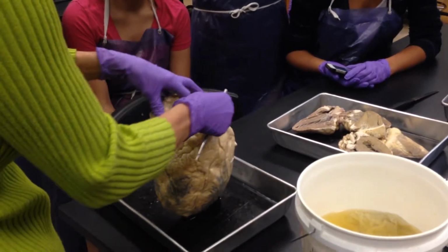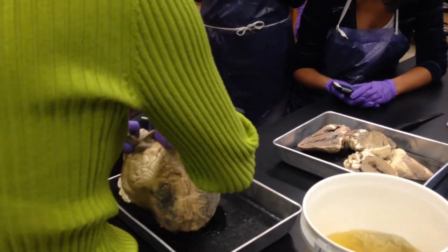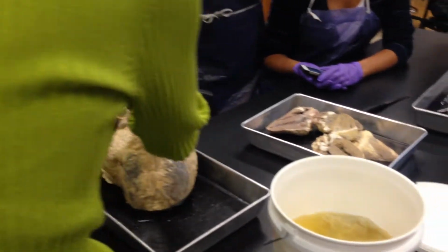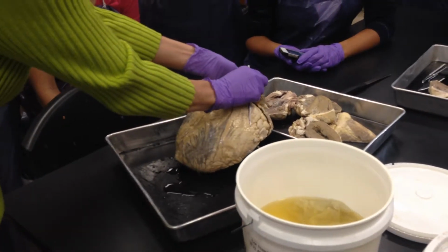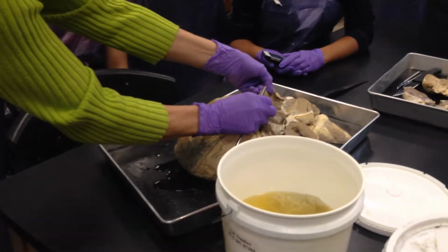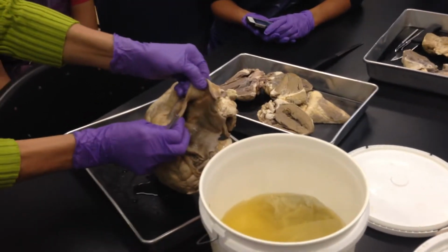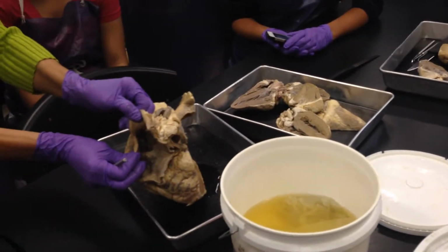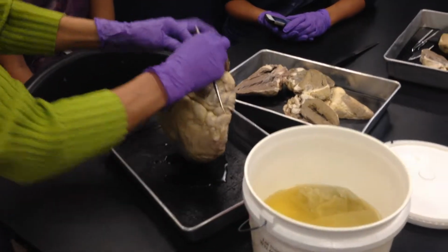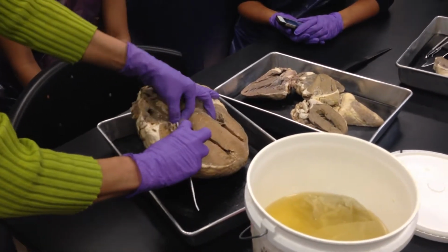If I open up the pulmonary trunk and I look down, you can beautifully see the semilunar valves. Can you see that? You want to try to make the same kind of cut that you did over here. Can you guys see that right there? See how nice those pulmonary semilunar valve pockets look? Okay, so those are the semilunar valves. Those are way different from atrioventricular valves.